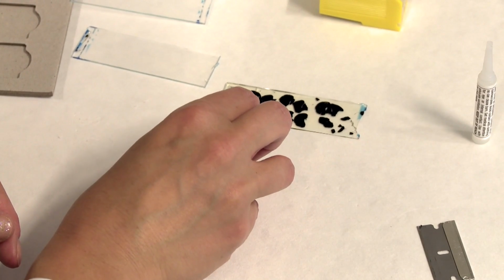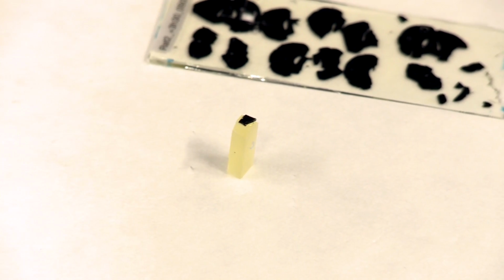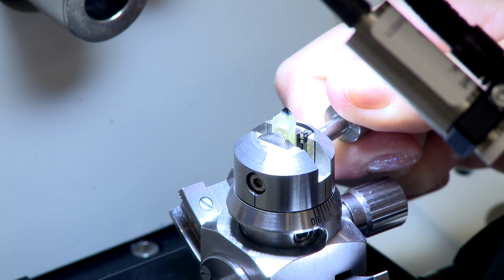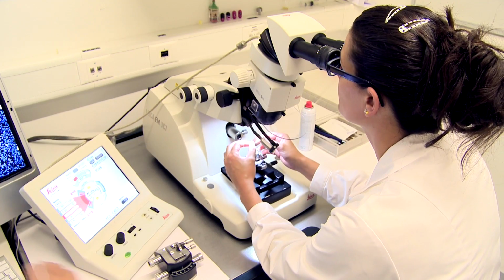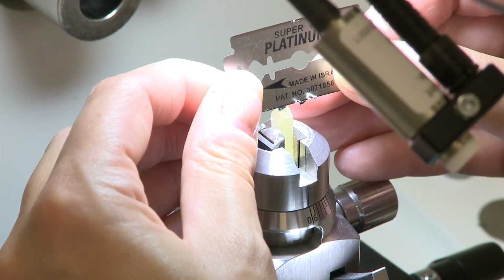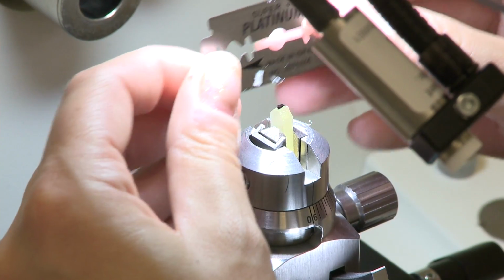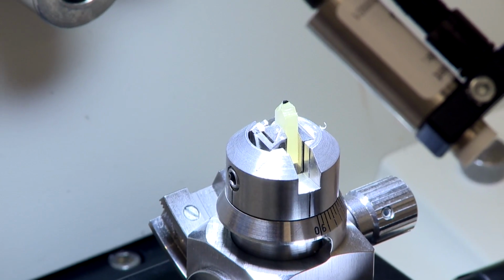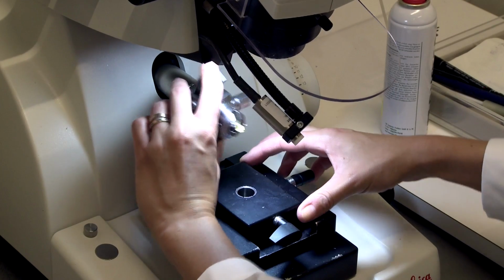This blank resin block is then ready for trimming and cutting in the ultramicrotome. So the first approach is to very firmly hold it in a sample holder of the ultramicrotome, and then place it underneath the dissecting microscope, and then again with a razor blade just trim away any of the excess material that we don't require. And this can be a long process to very precisely make a block of the exact region needed.